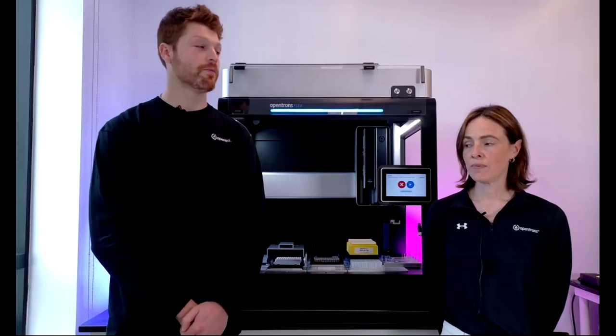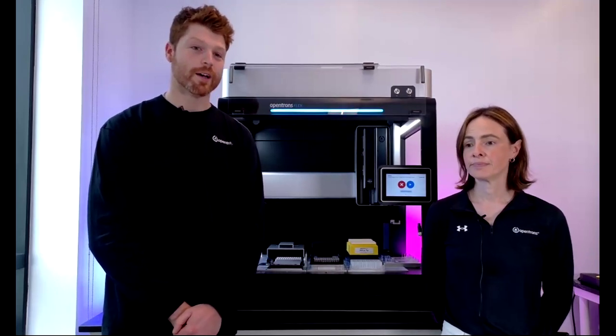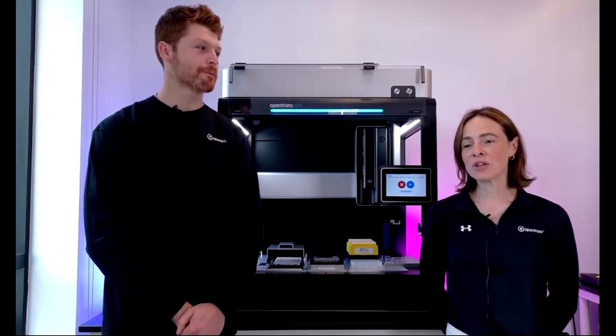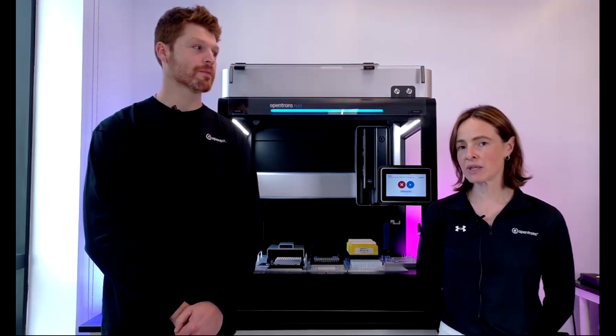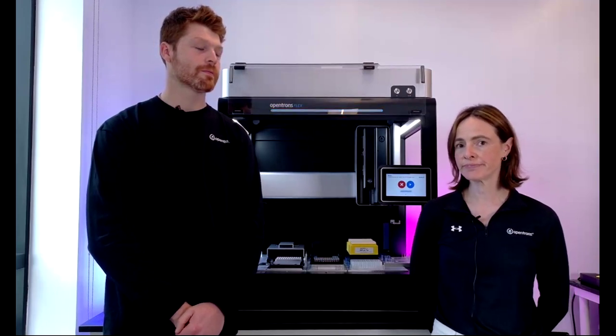Moving on, Guillaume asks, what is the error rate of these pipettes at low volumes? Those values are published on our website as well. Do you have them off the top of your head? I don't have them off the top of my head, but if you go to the pipettes page on our website and scroll down under tech specs, you can see the error ratings at different volumes. I think it's right around 5% CV.